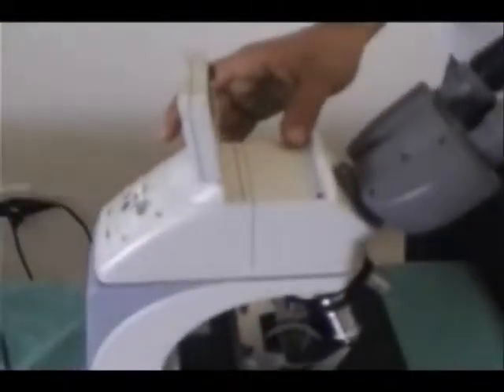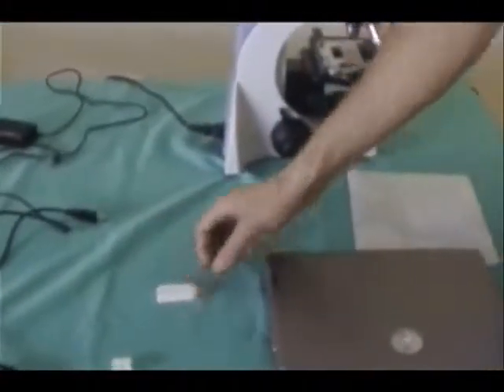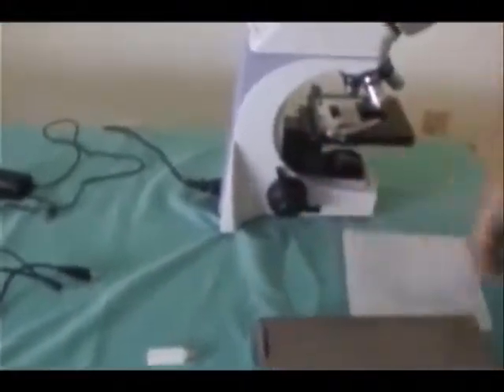Now, what we're going to do is connect the LCD monitor capabilities on the microscope to the computer using this USB that comes with the microscope and using the software as well that comes with it. This might look simple, but I'll walk you through it so you know exactly what to do.